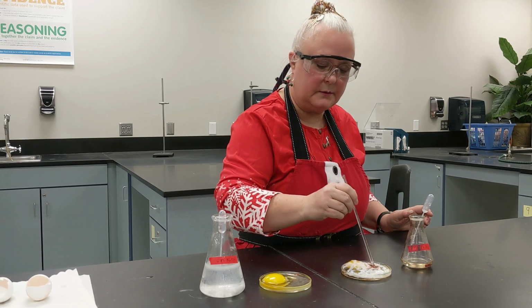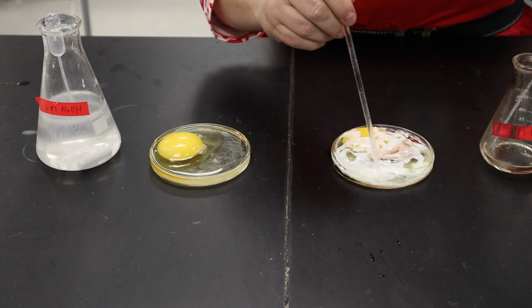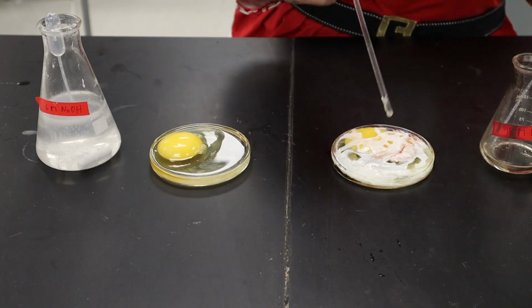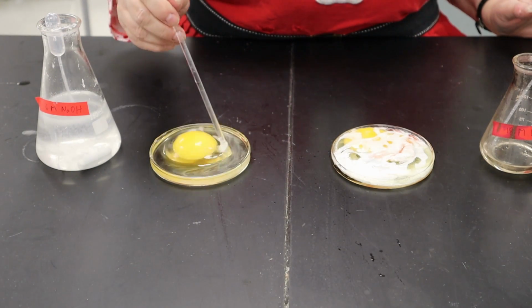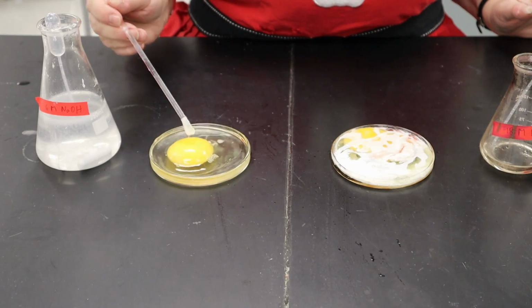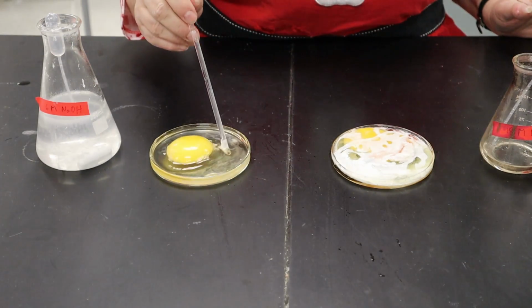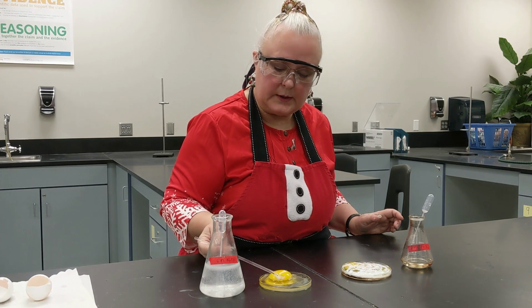Here's the one with the acid. It's even turning red. And here's the one for the base. And you can see that it is starting to turn kind of a solid. And that solid would be a little bit like soap.